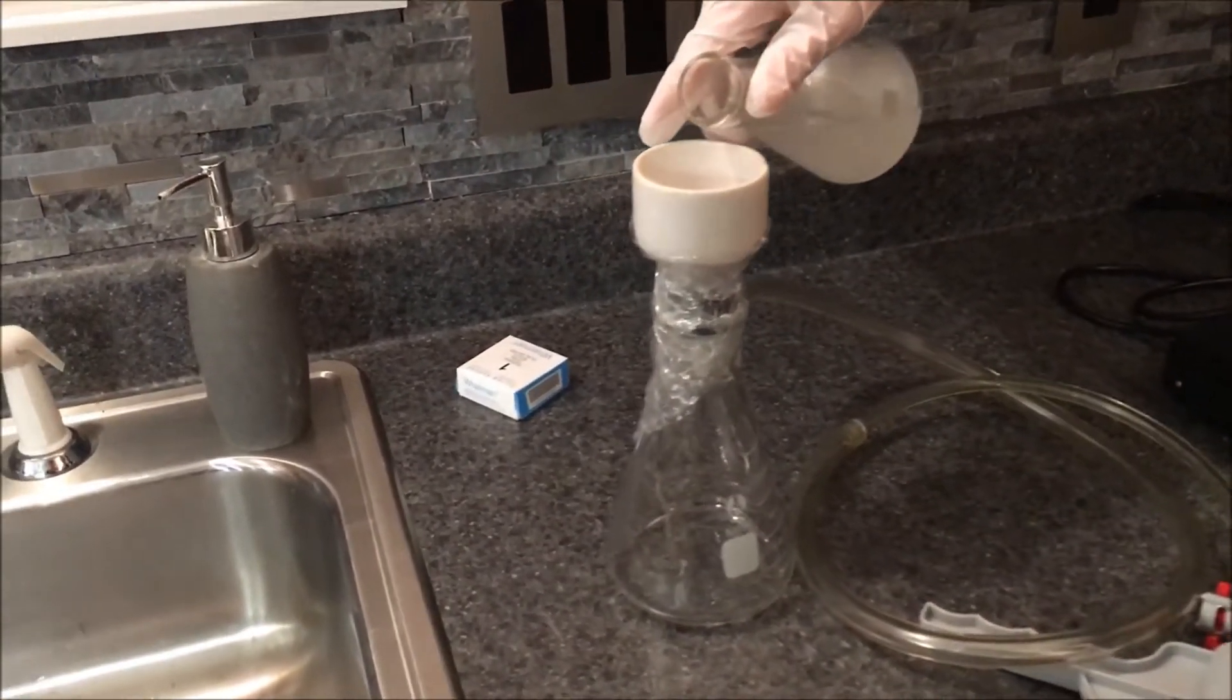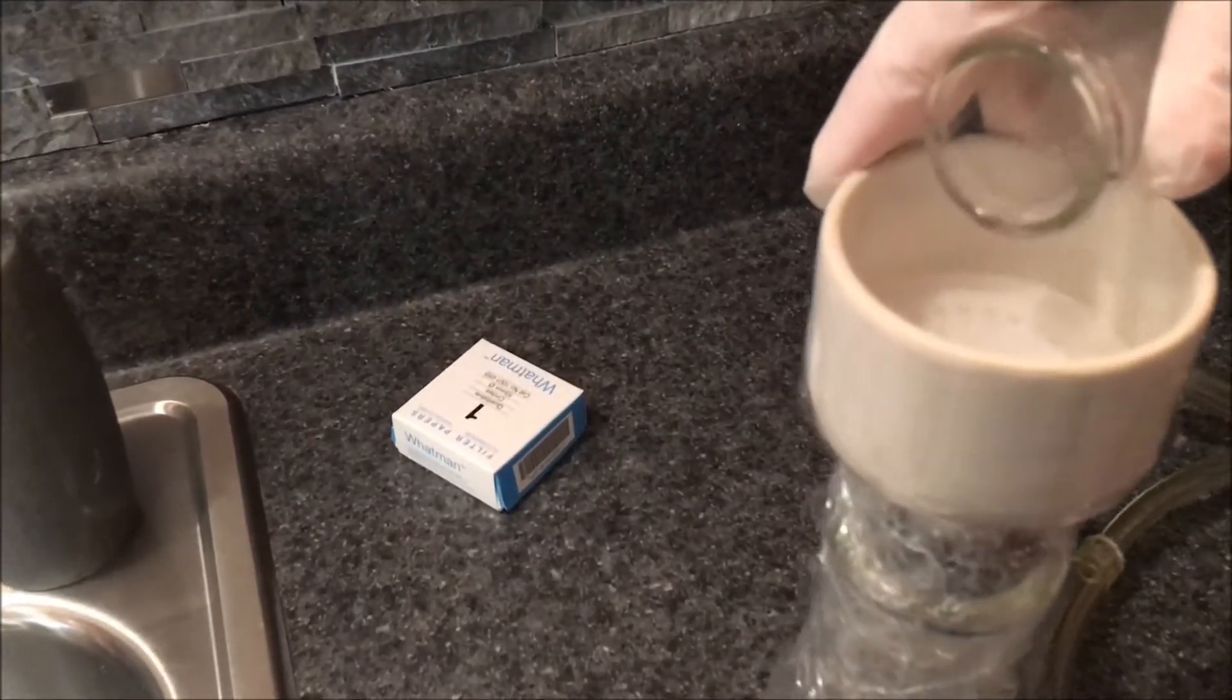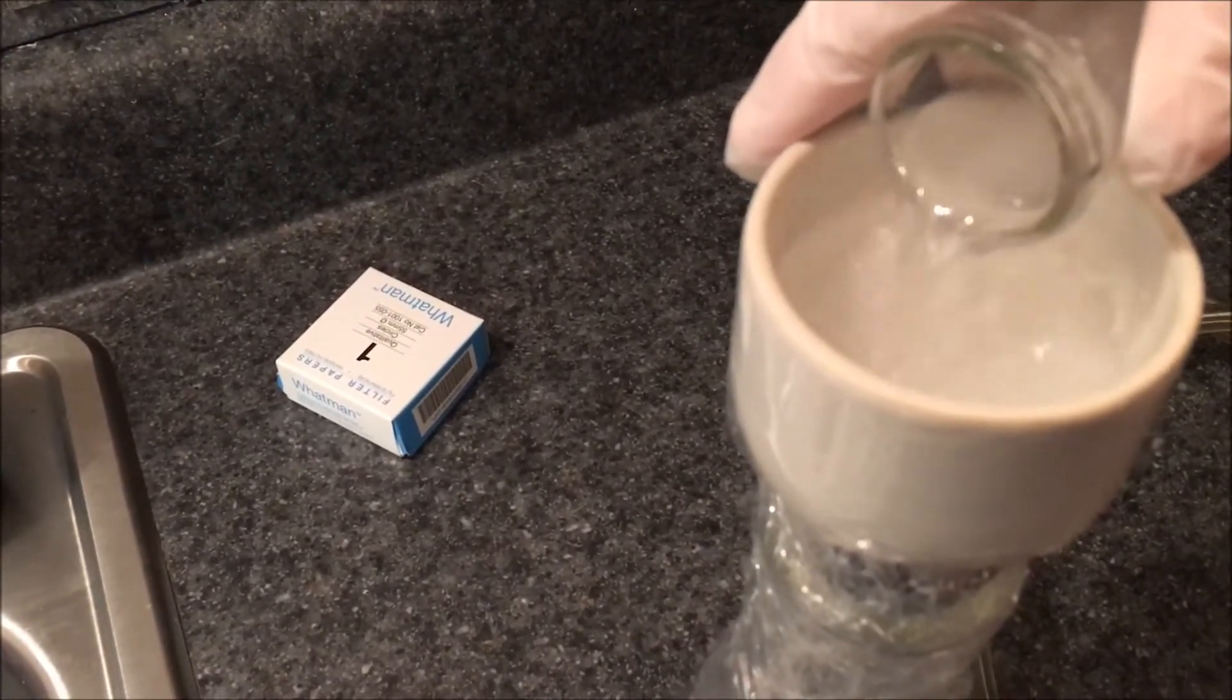After it has been stirred and you have let the insoluble settle out of solution, then you should vacuum filter it.